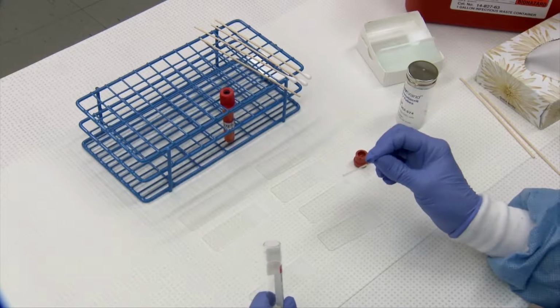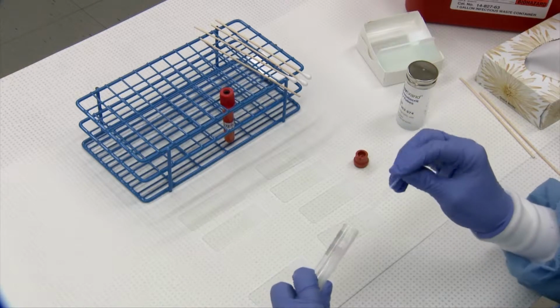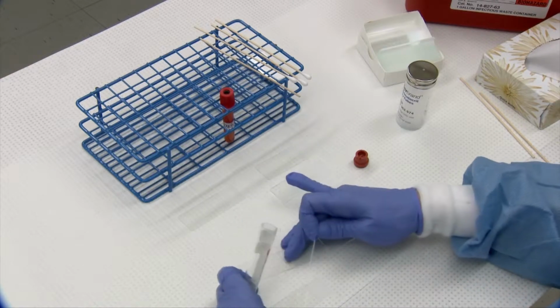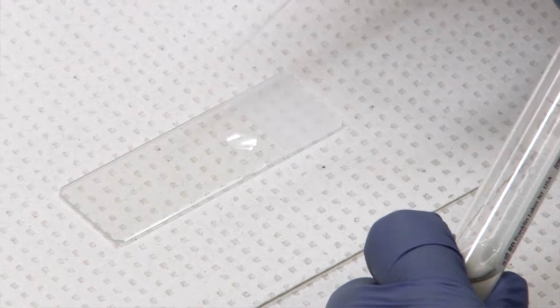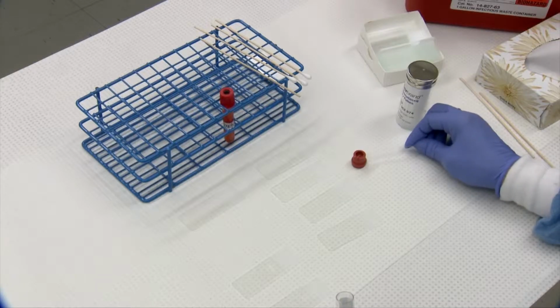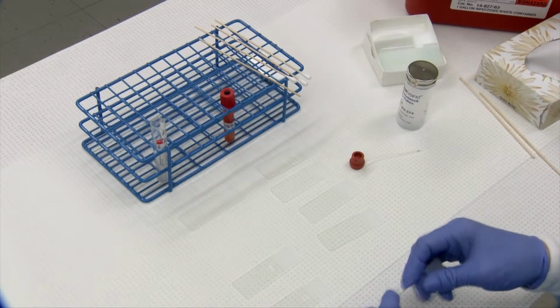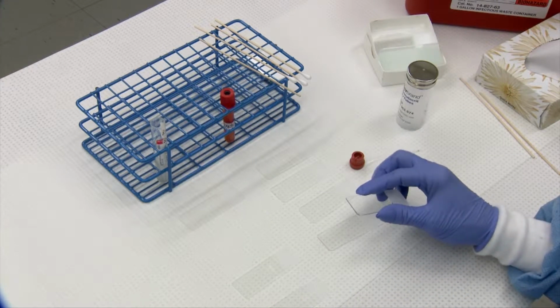Your direct and your line smears can be done using a PCV tube, packed cell volume tube. Fill your tube about 3/4 full, and you'll make a medium-sized drop again above your frosted edge. And these are very runny samples, so it's a bit tougher to make a good smear than it is a blood smear. You don't need to worry about quality really. More of the goal is to get cells on the slide.